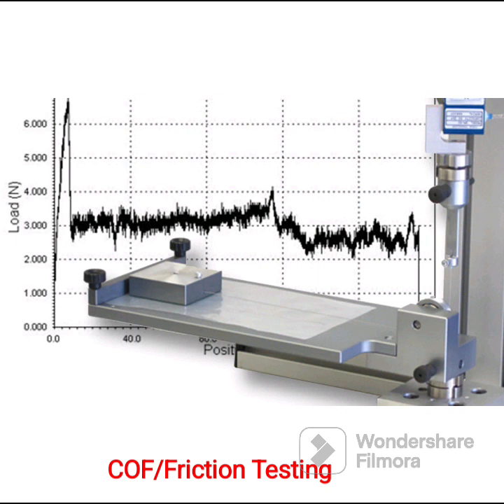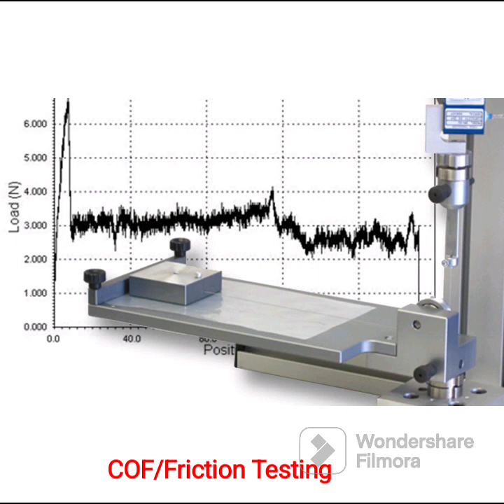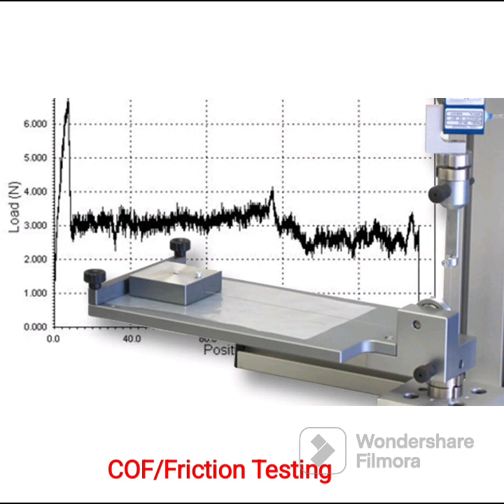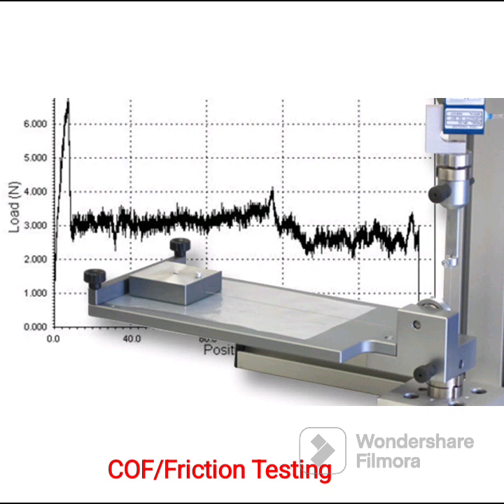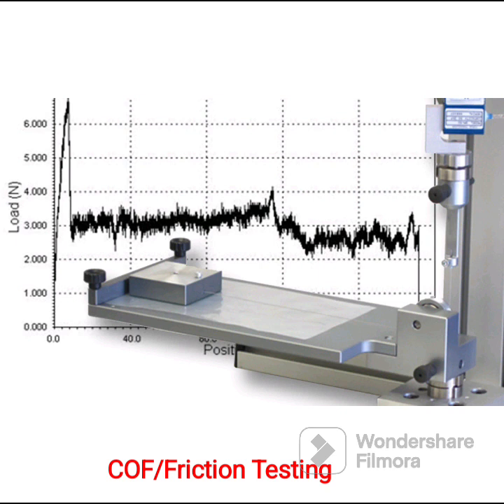A variety of factors can affect coefficient of friction tester measurements, including abrasion, coatings, varnishes, printing, and most importantly humidity.